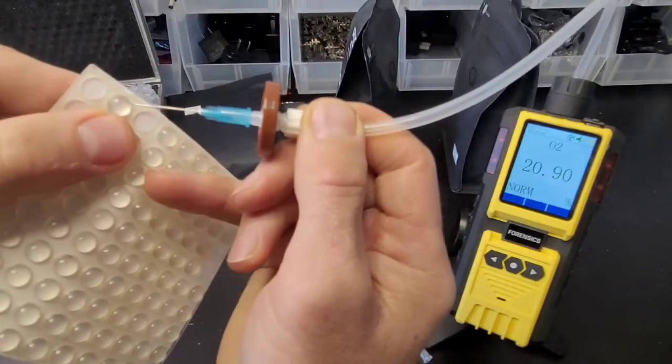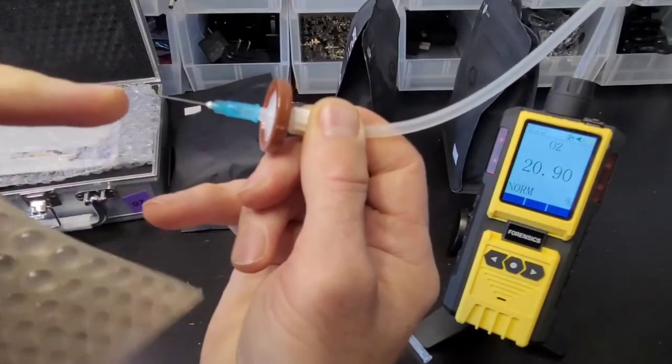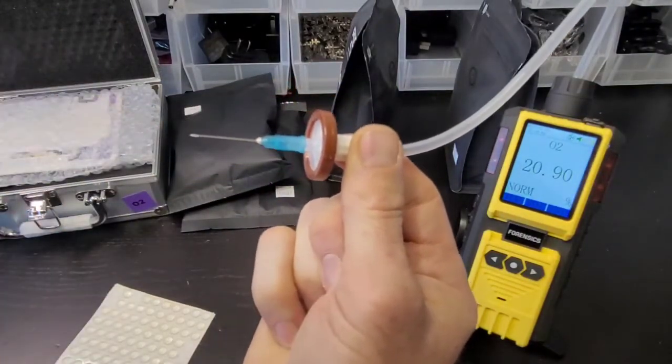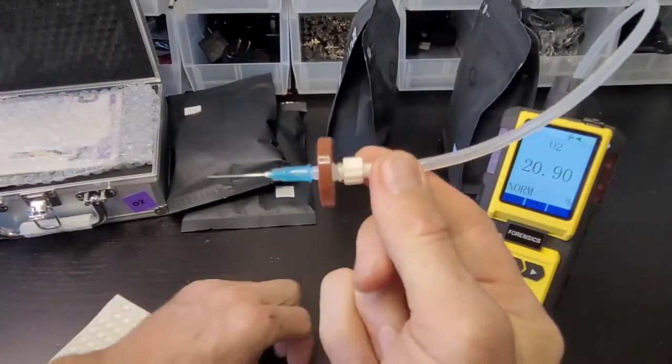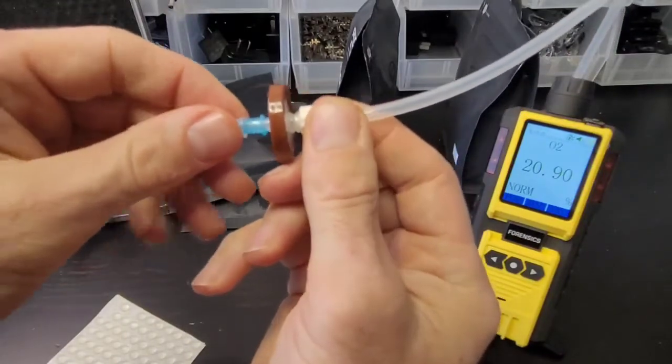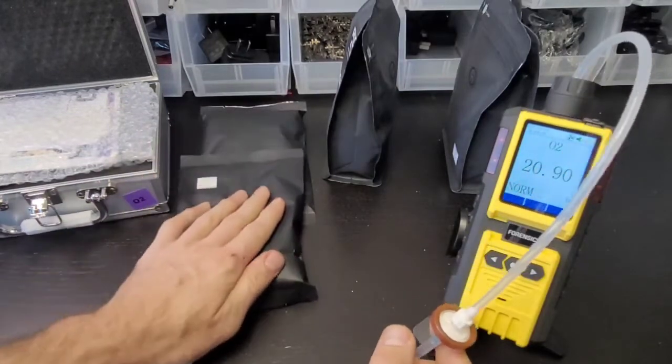You know air is going through and into the analyzer if it's stressing. That's the first thing you have to do - confirm air is going through via that simple test. Now let's put the cap on and get our packages ready for analysis.